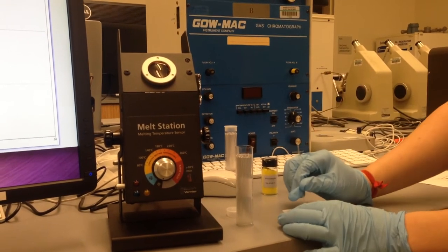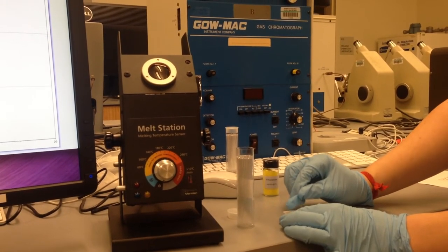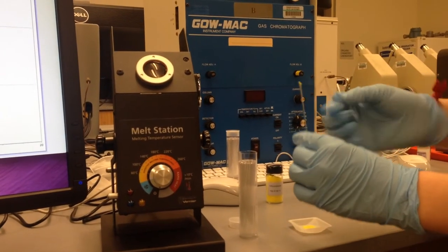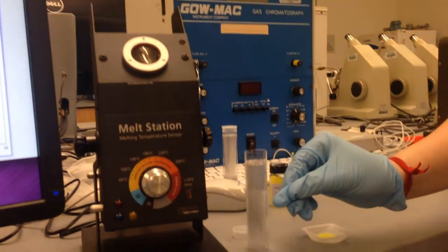To get sample, gently press the open end into the sample pile. Then, tap it against the table to get it to fall into the closed end.